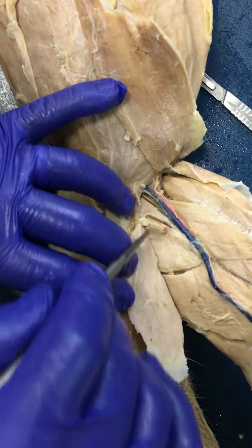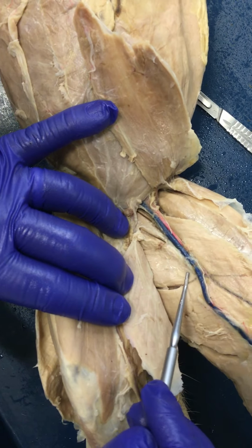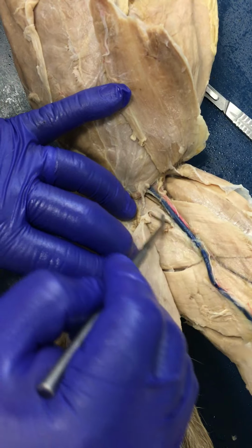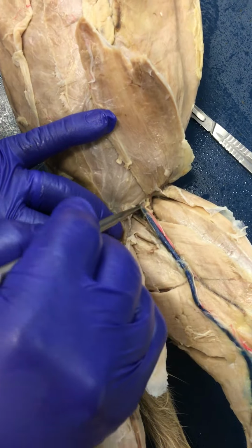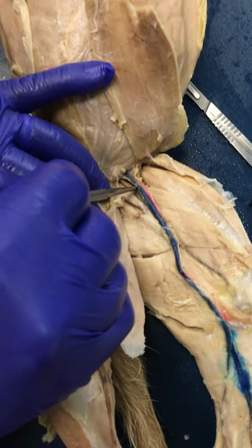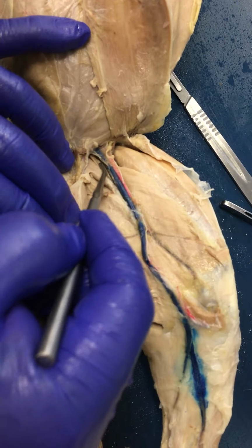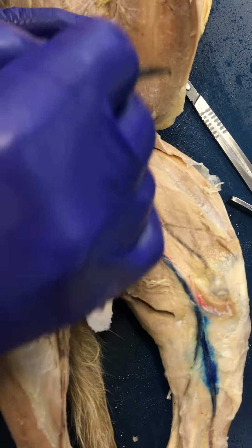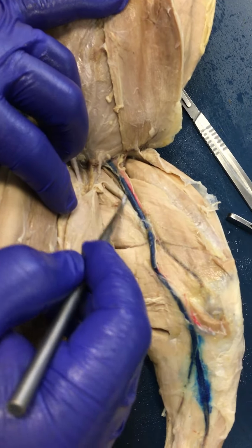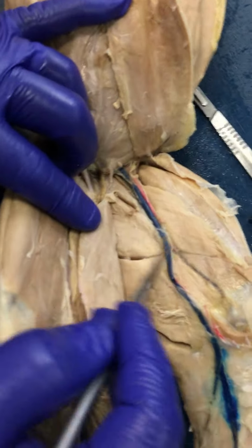So in humans, we don't have an adductor femoris. Instead, there's a large adductor magnus. There's going to be relatively deep to the adductor longus, which is seen here, and then to the pectineus as well. The pectineus itself is fairly deep. Right? As far as a good way of remembering the pectineus, it's going to be medial to the blood vessels. Right? The action of all of these is pretty much going to be to adduct the thigh, right? As well as medially rotate that femur.